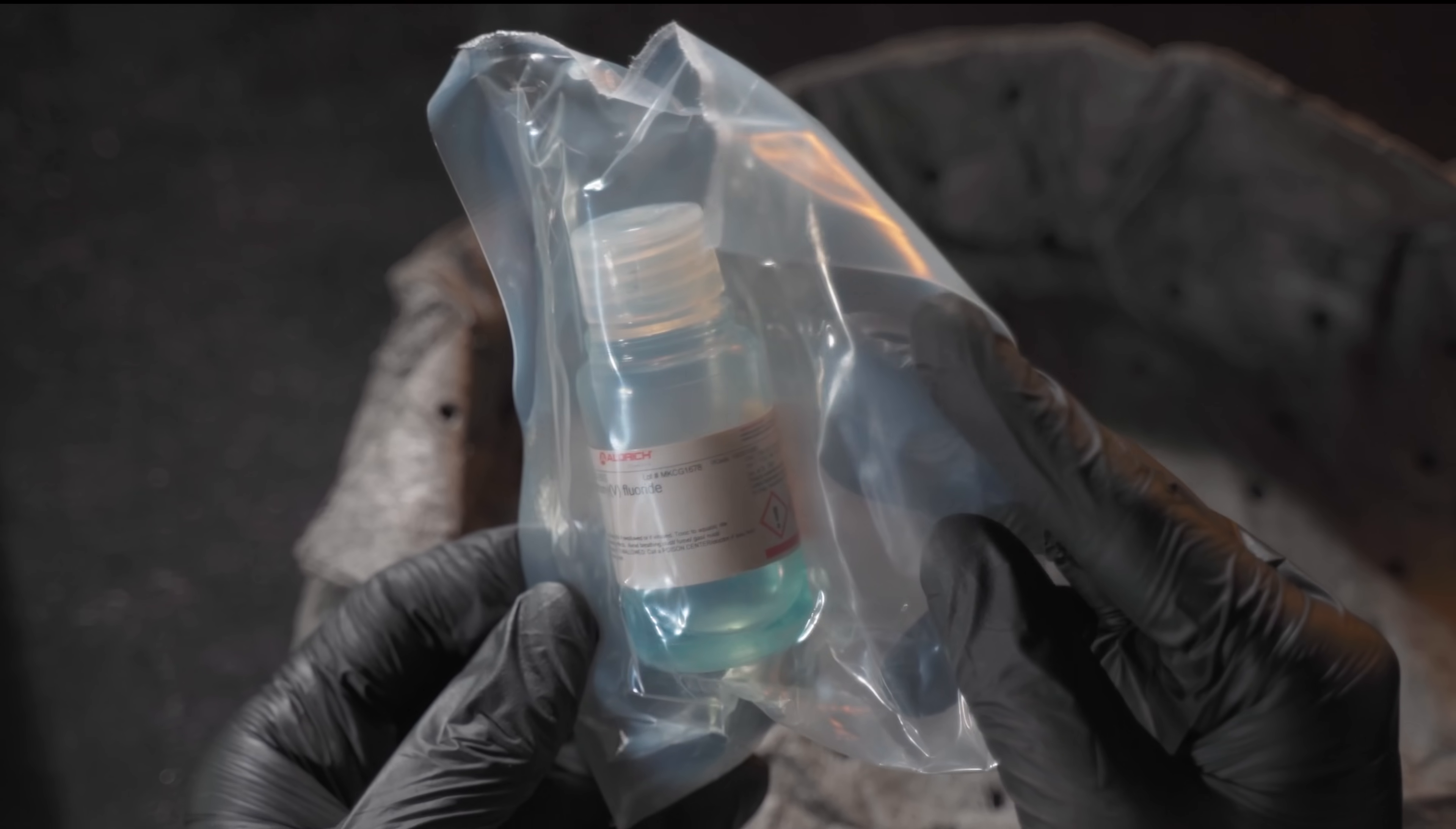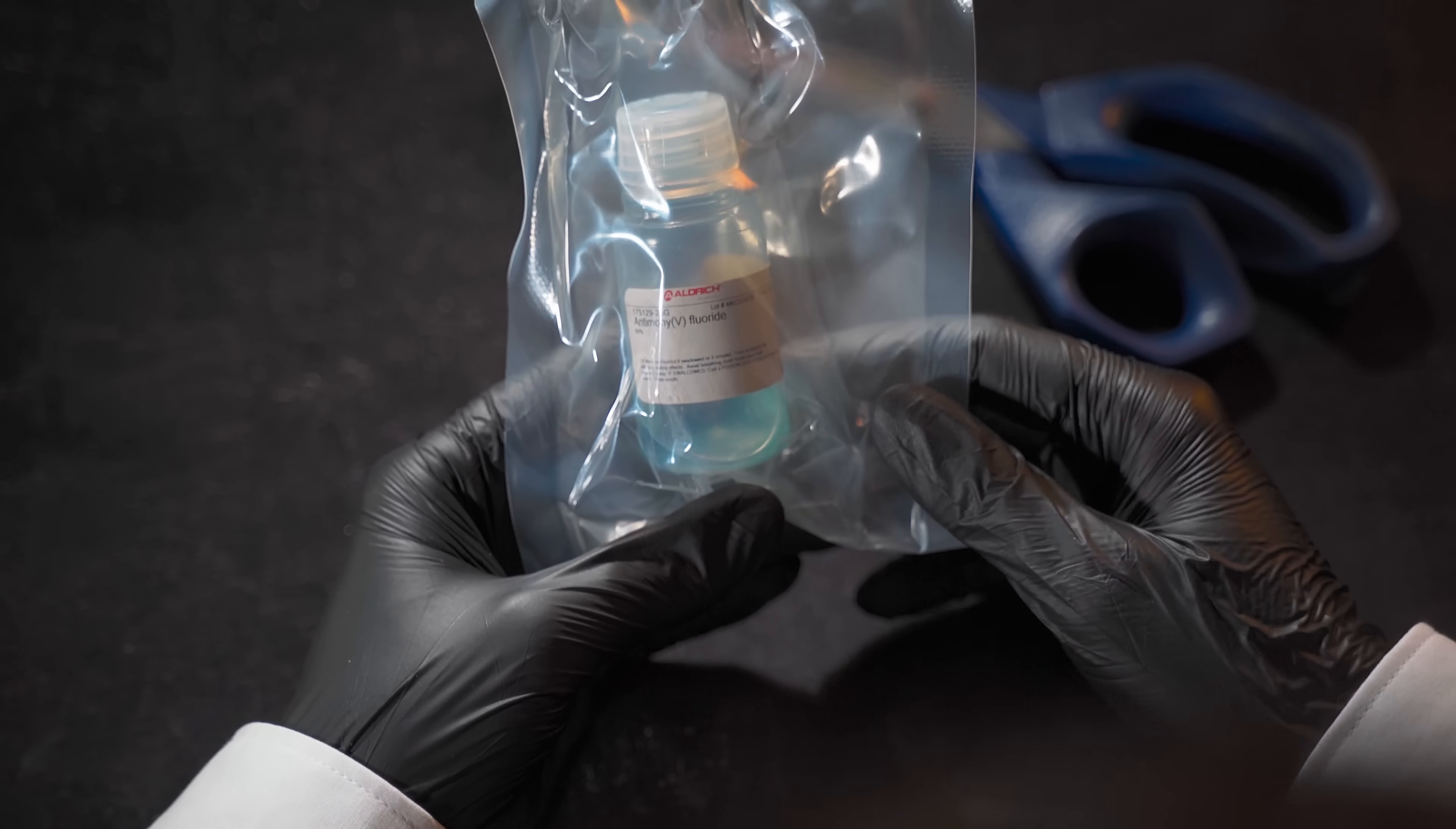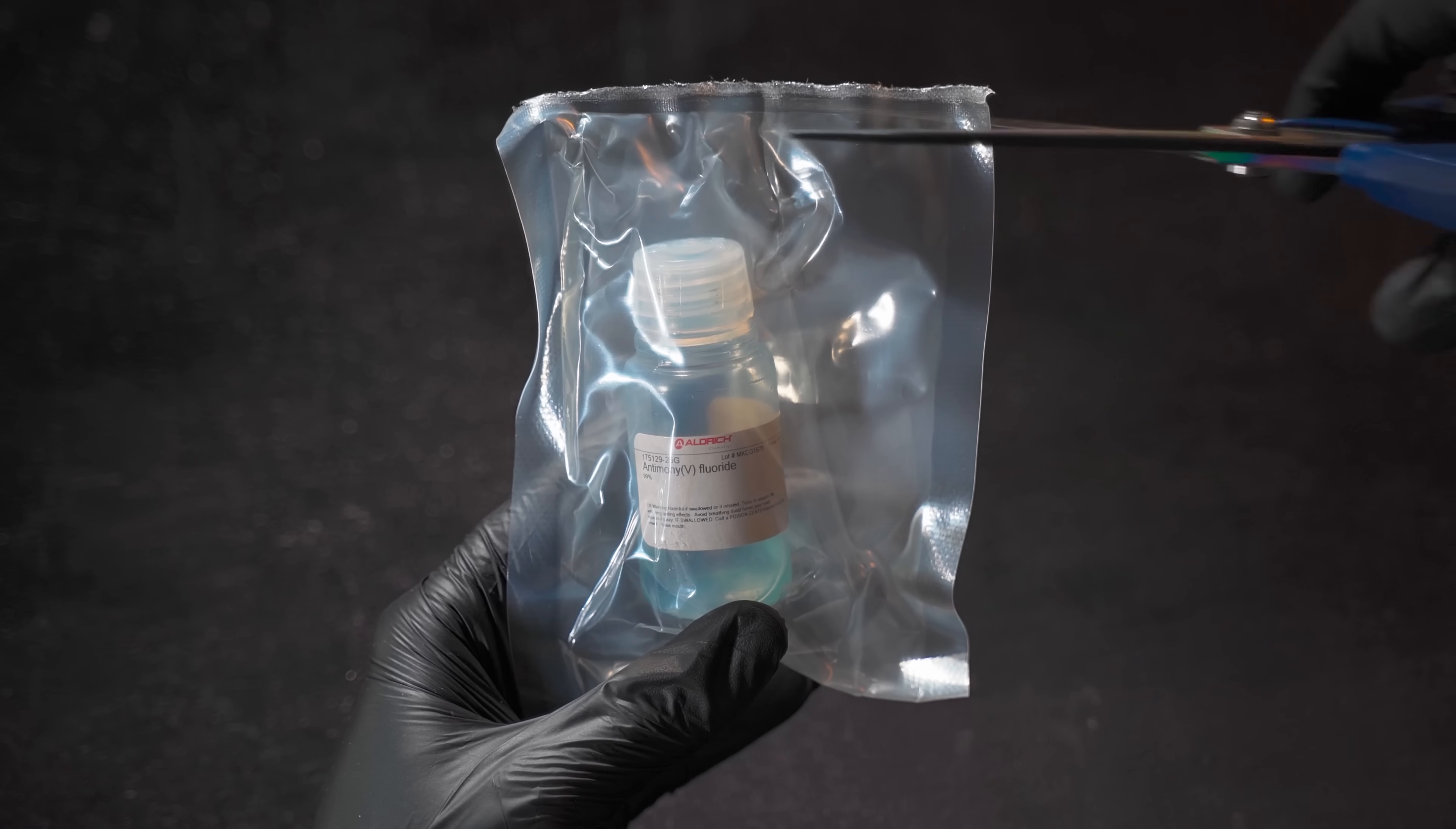Look at that, antimony pentafluoride should be a transparent liquid, but in this case it has a bluish tint. That's very weird, since it was a fresh reagent that was stored under reasonable conditions.